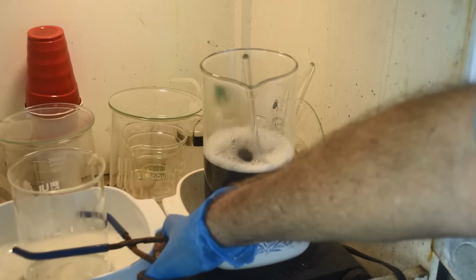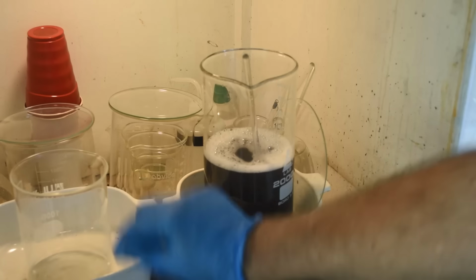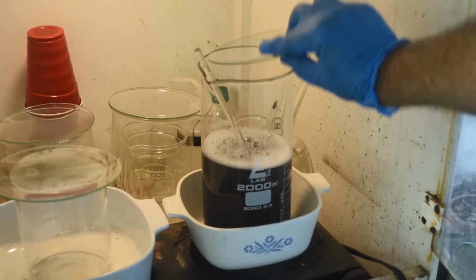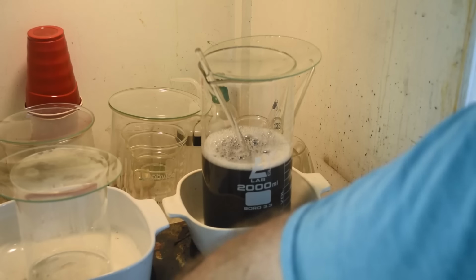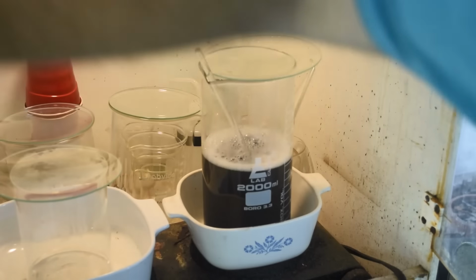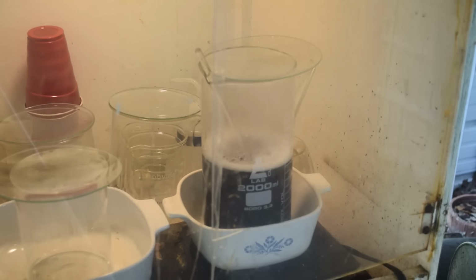Actually, I don't think I'll put it all in because we're getting pretty high. This stuff tends to want to foam up if I boil it covered. So I'm going to bring it back up to a boil. And we'll see if the liquid clears anymore. Get some more palladium on the bottom. That would be nice. Yeah. All right. Let this go for a while and see what happens.